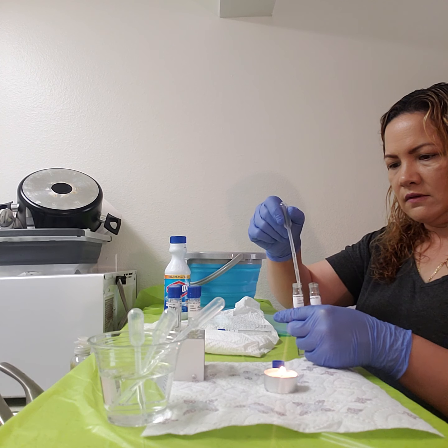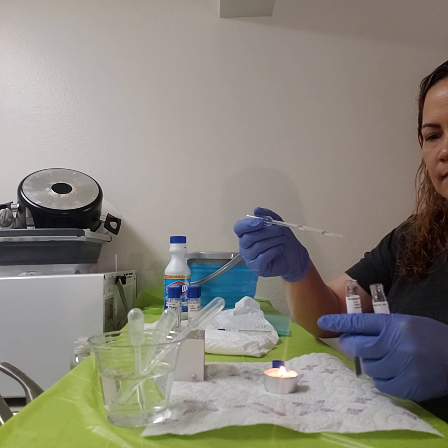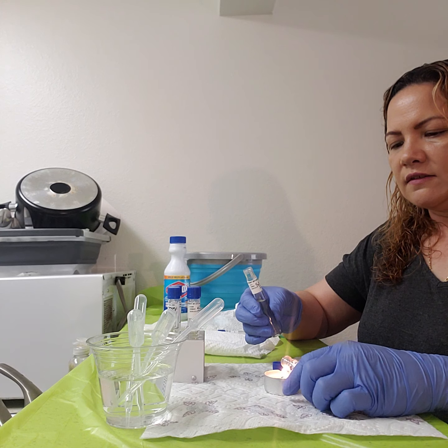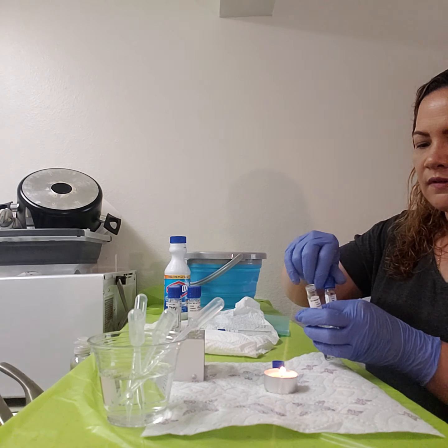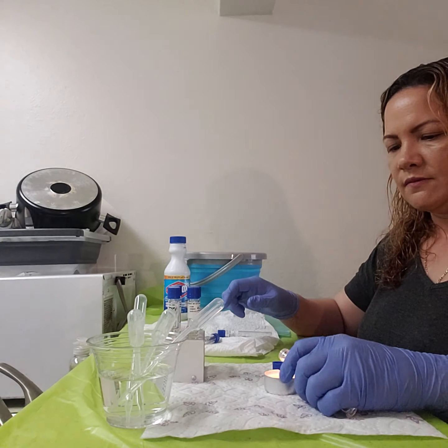So 1, 2, okay. And then, you don't want to do that. What am I doing? Okay. So I need to go ahead and sterilize the top. And this one is actually the culture. So I'm done with this one. And I'm gonna do the 15% as well.